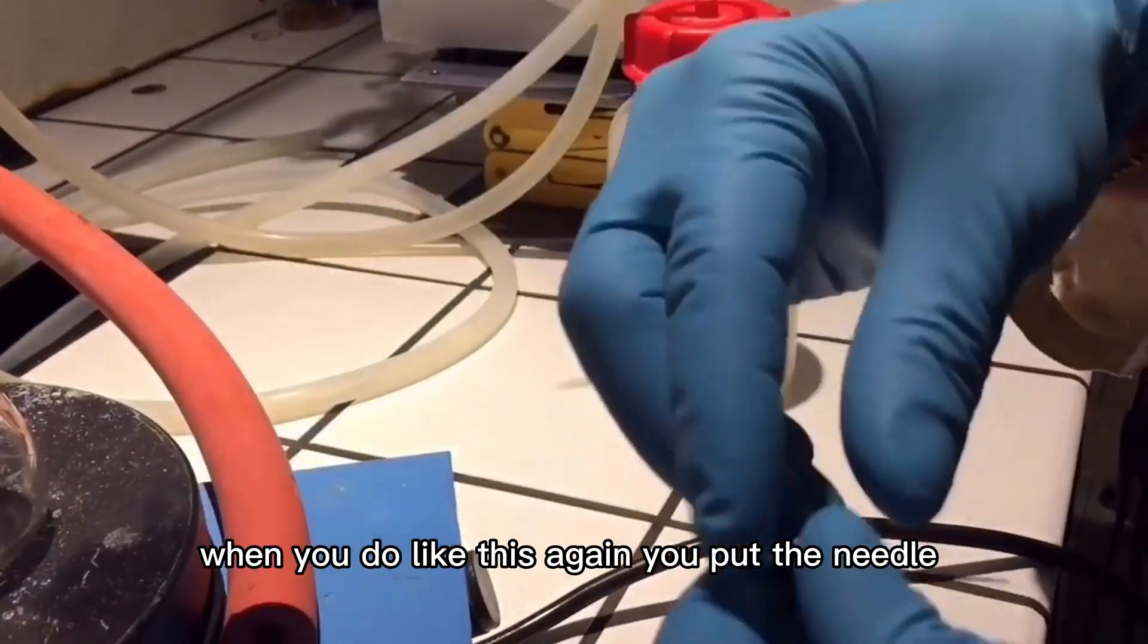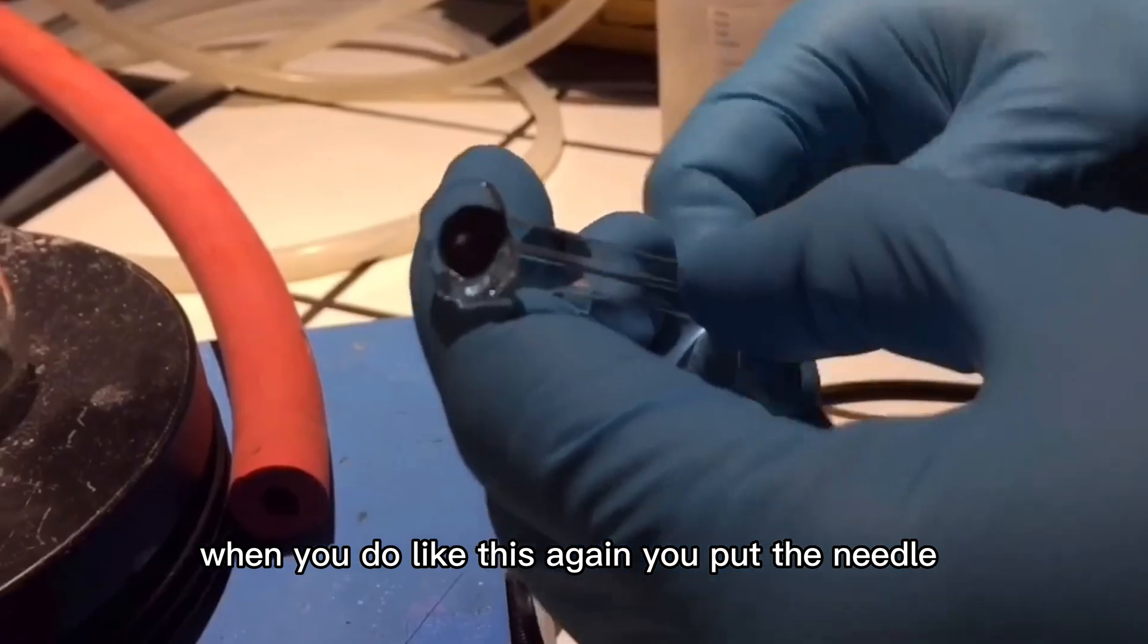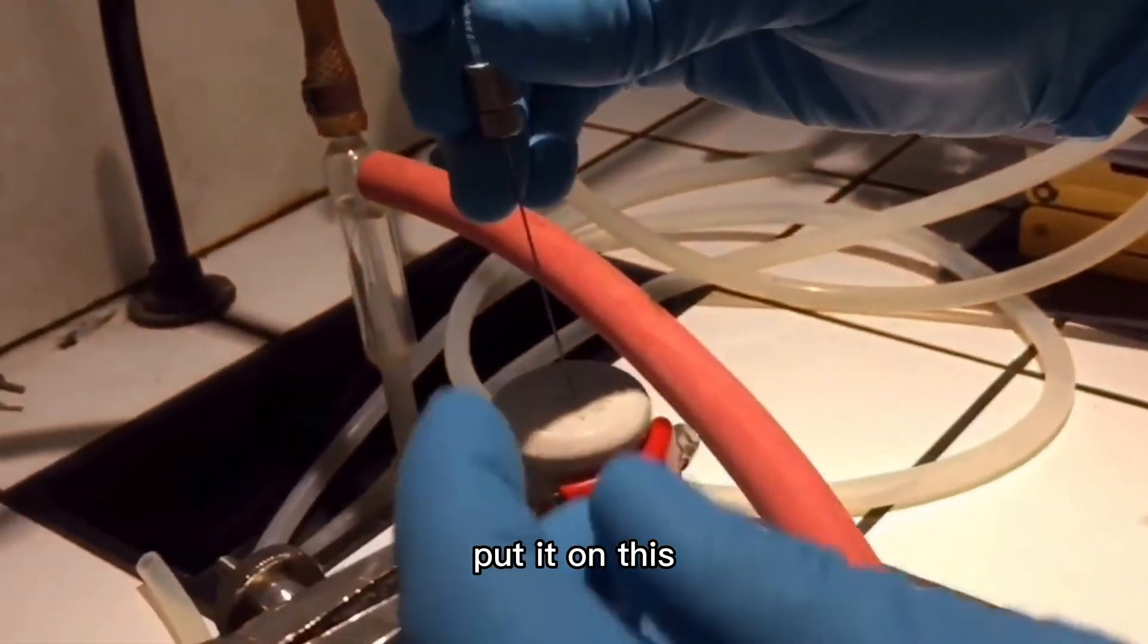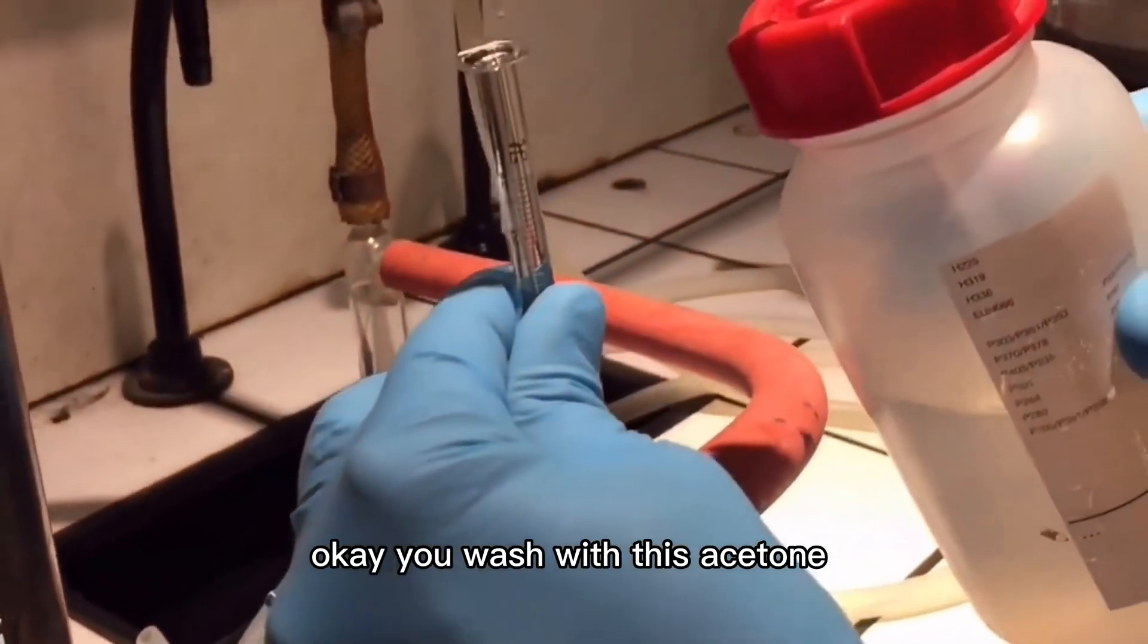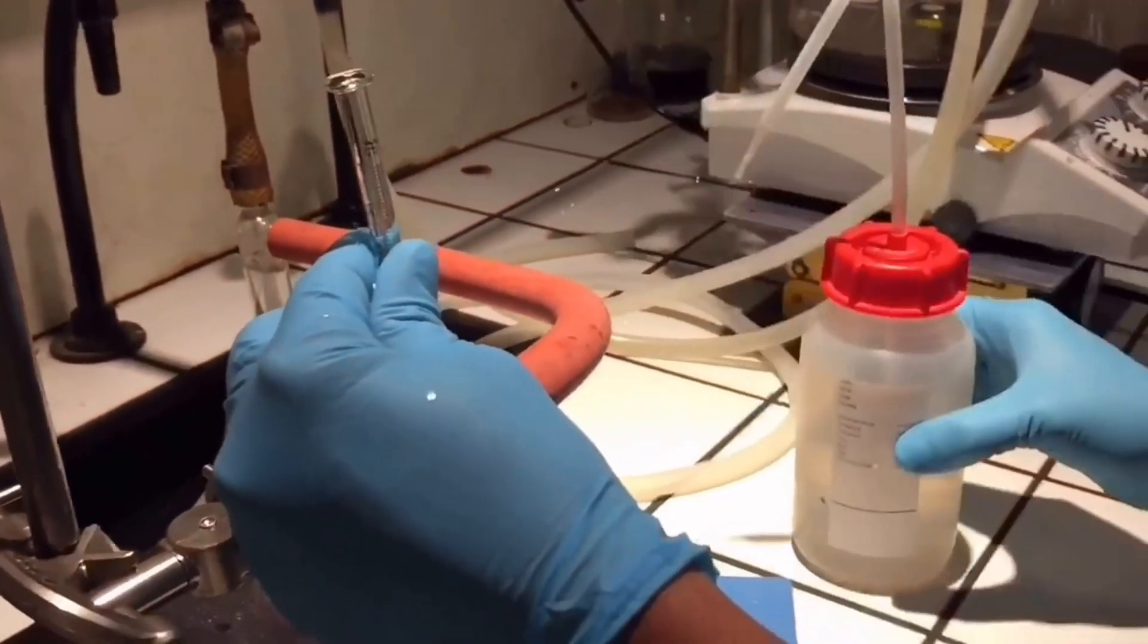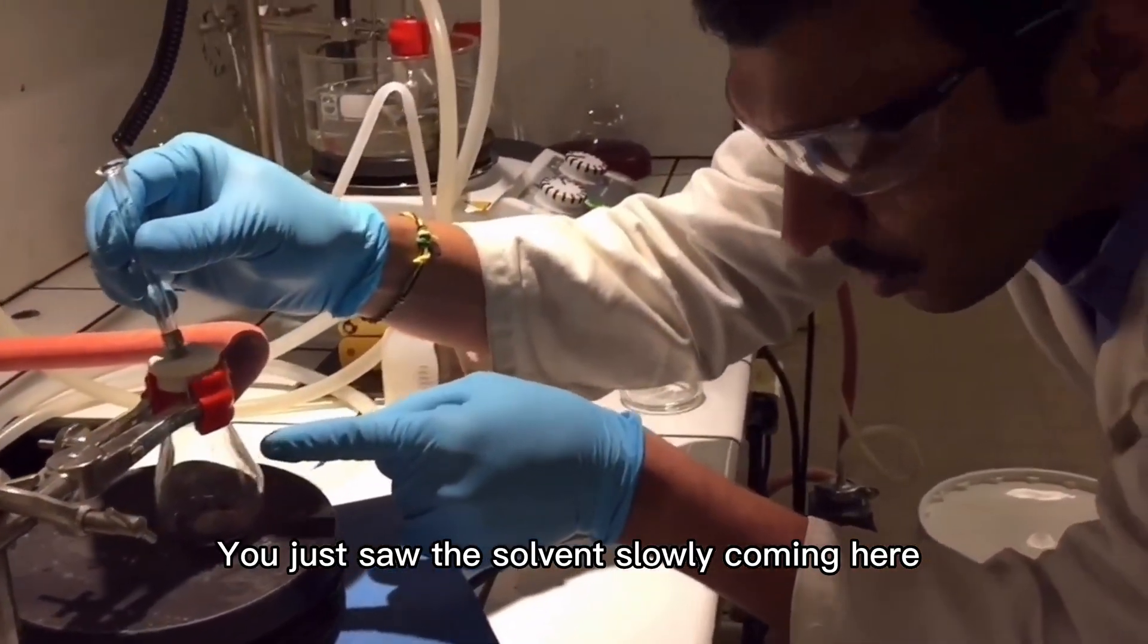When you do like this, again you put your needle back on. Wash with acetone and observe the solvent coming slowly here.